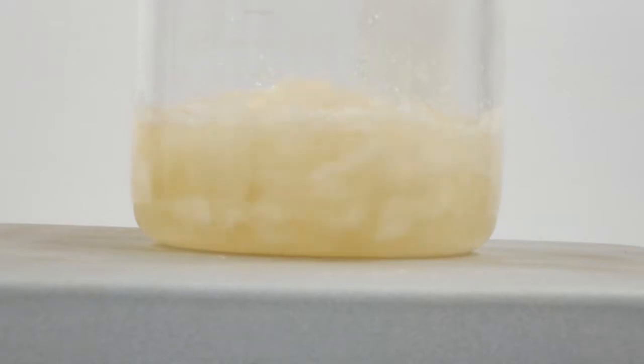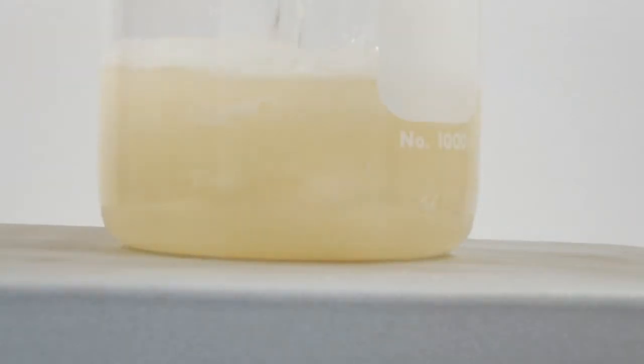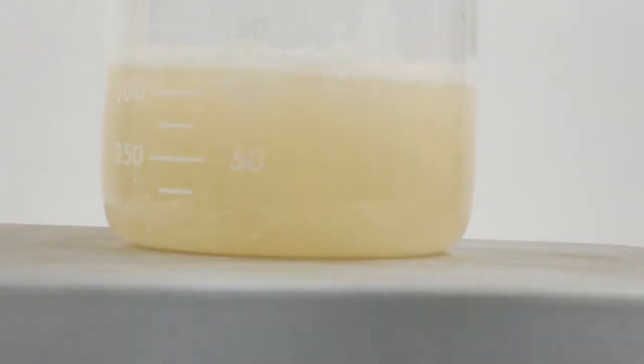After watching the beaker dance around on the stirring motor for a few moments, I finally added more water. These proportions are designed to give me a final mass of 300 grams, so I'm not entirely sure why I was being so stingy with the water. Proportionally, I will use about 250 grams of water, so it doesn't make a lot of sense to make life more difficult at this stage.